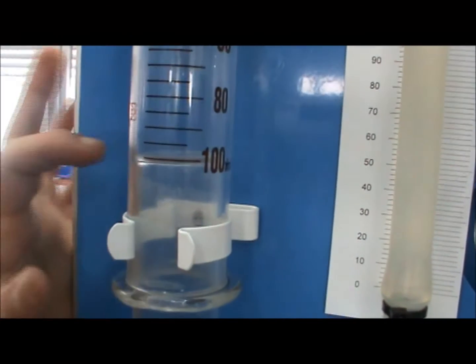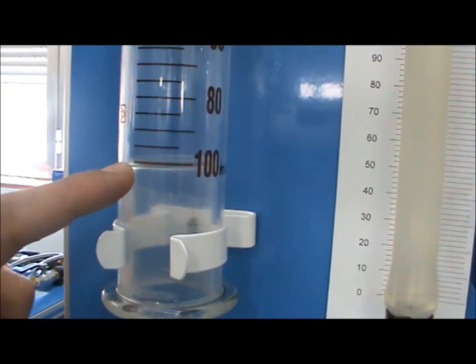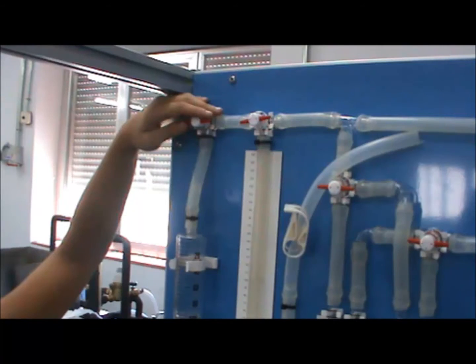Take the final sample of 100 milliliters, and be careful to note how the volume is measured with reference to the plunger, in order to maintain consistency with measurements. Close VT3 to isolate the sample, and let it stabilize for approximately 10 seconds.